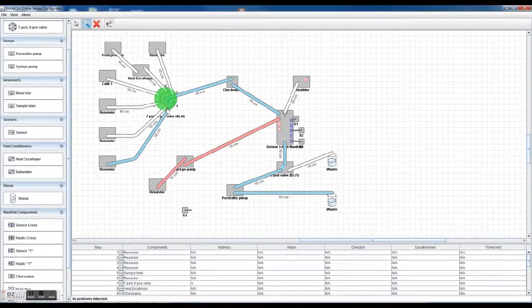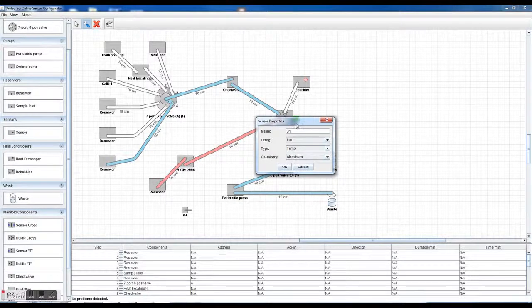This really allows us, this heat exchanger here, the variable volume allows us to really match it to the sensor volume here so that the conditioned fluid can be injected, maybe via syringe pump, directly from the heat exchanger into the sensor. And of course you'd want to have this heat exchanger take into account all the fluidic volumes from here to here. The other thing is, yeah, maybe you want to name this. Maybe you want to have a nitrate detector here. Instead of a luer sensor, you want a quarter 28 sensor, and not a temperature sensor. You want an ion selective electrode.